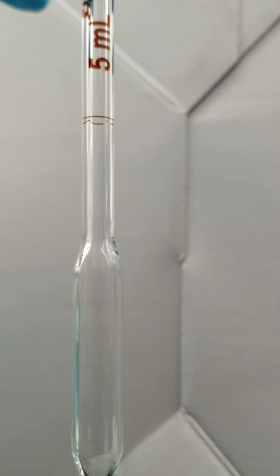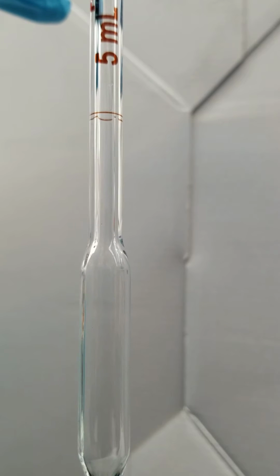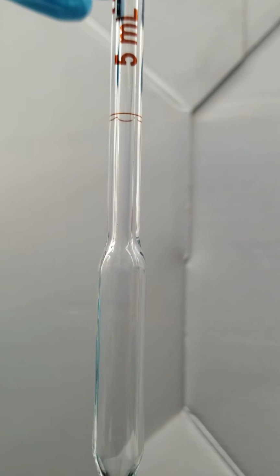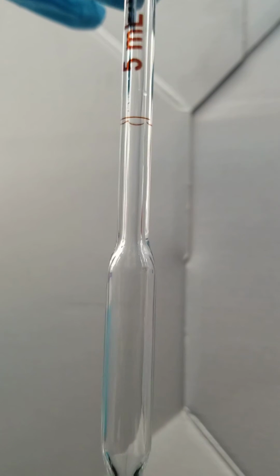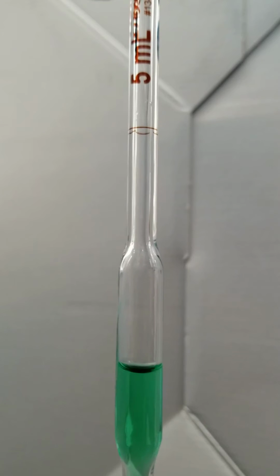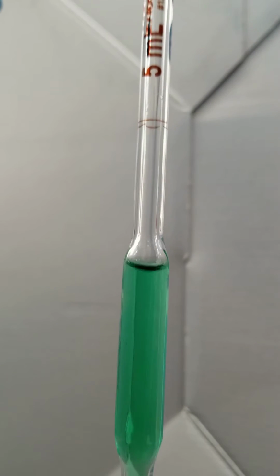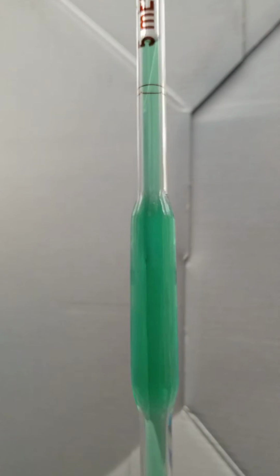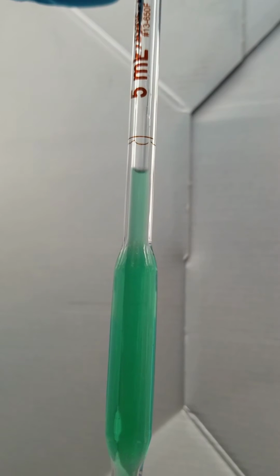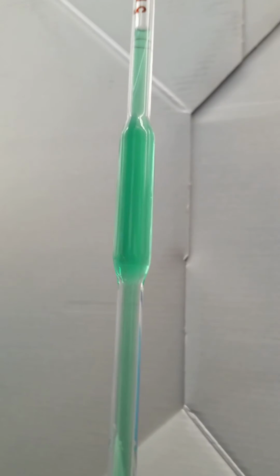Everyone, hi, we're back. I watched the pipetting video and I noticed that every time I tried to show you the meniscus, since I wasn't able to see my screen, I was not making it so that you could see it, and my arm was in the way. So I'm gonna show you what was happening that I could see, went past the line, and here, we're gonna look.